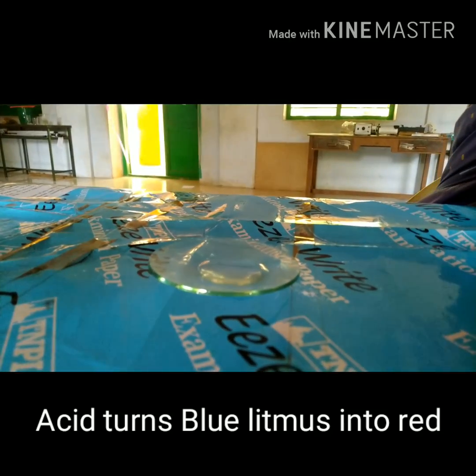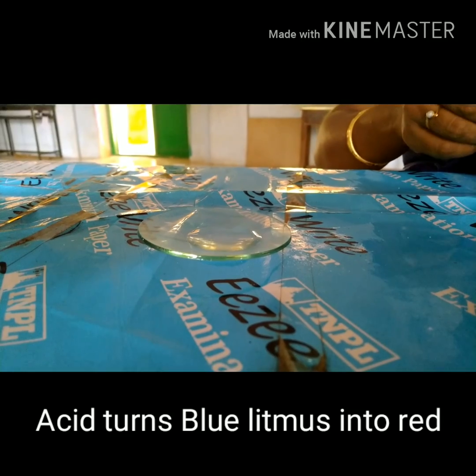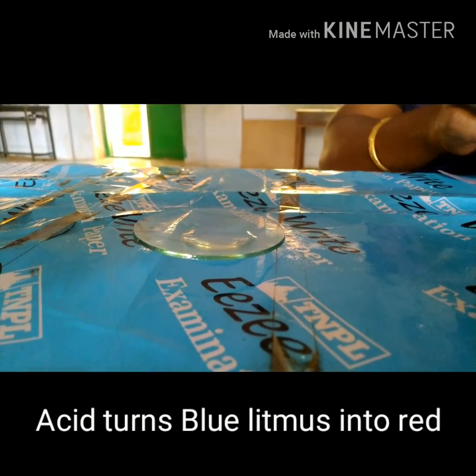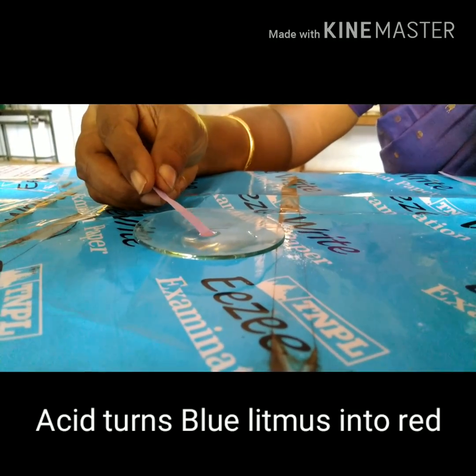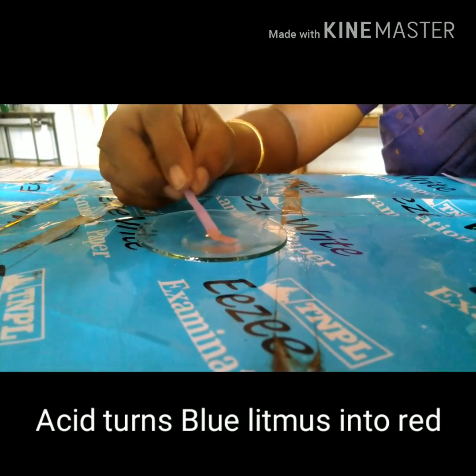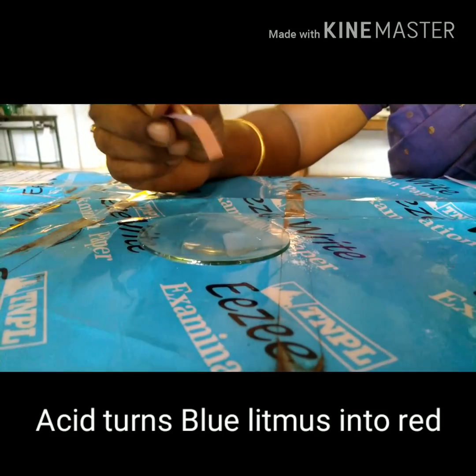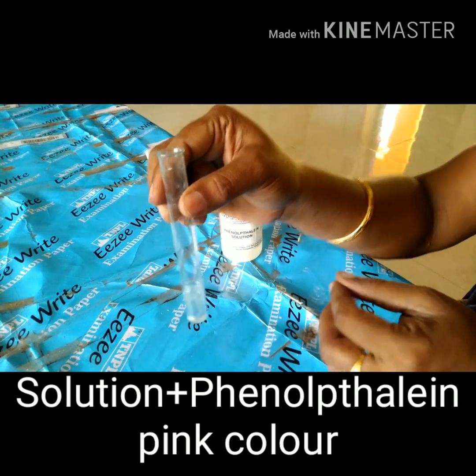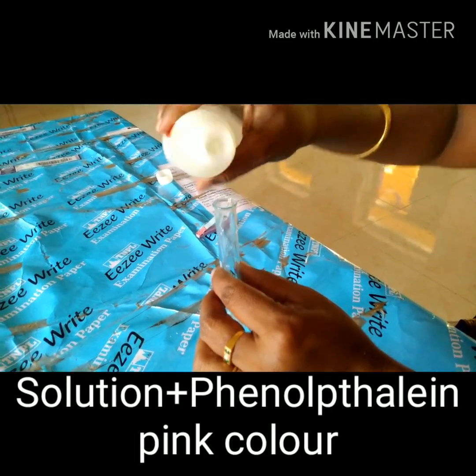You take blue litmus paper and touch it with the solution. Note the differences — the blue litmus paper turns into red color. So the given solution is acid. Now let us come to the case of the base.